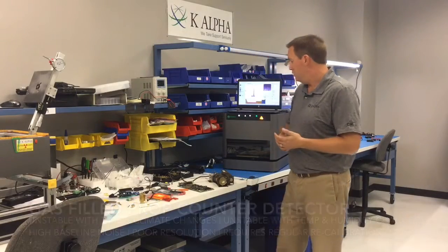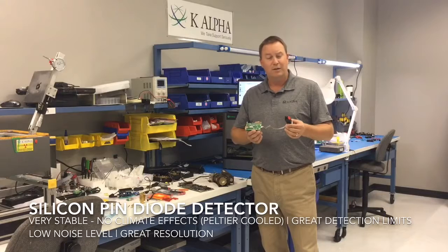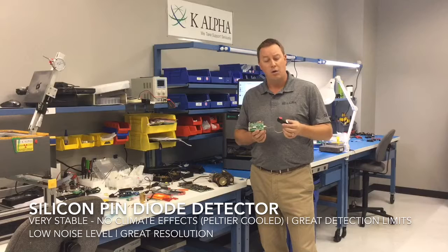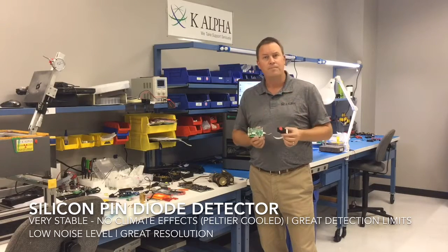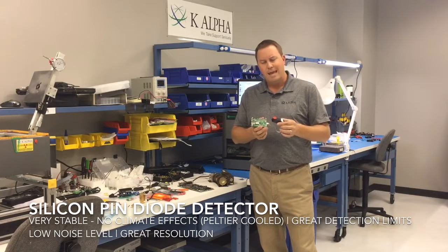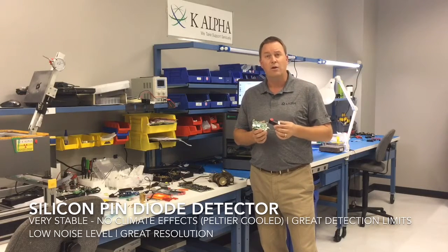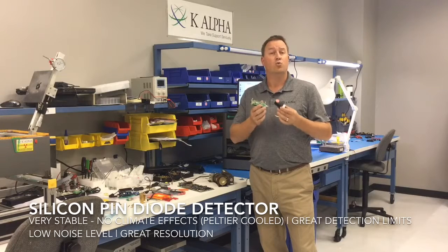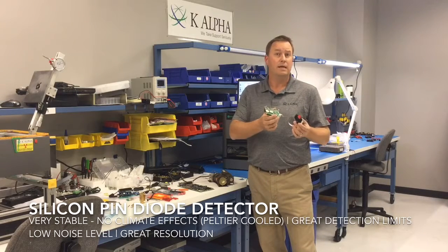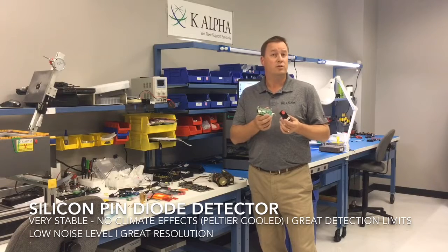The newer technology is more of a solid state detection system. I've got an example here of one of our silicon PIN diode detectors. There are two different types of solid state detectors that are used now: the PIN diode, or just the PIN detector, or a silicon drift detector, or SDD. With a PIN detector, you can see the size is much smaller than this whole assembly here. But basically it improves your resolution greatly, so you can resolve neighboring elements like nickel, copper, zinc, things like that. It also has a very, very low base noise level, so it really improves your sensitivity.